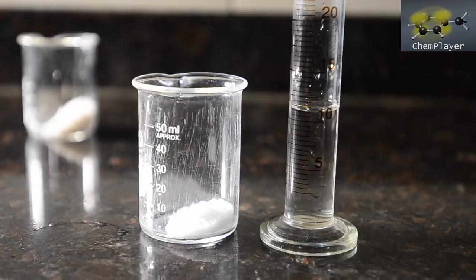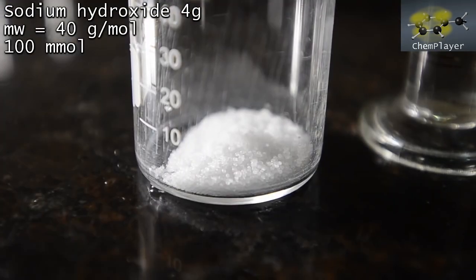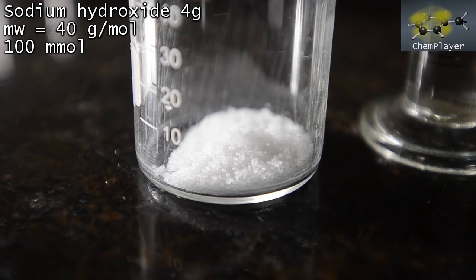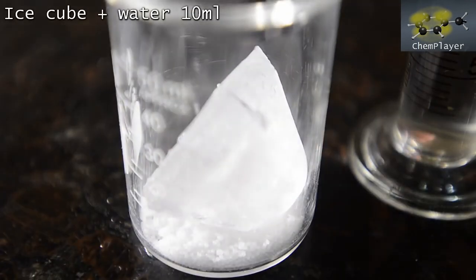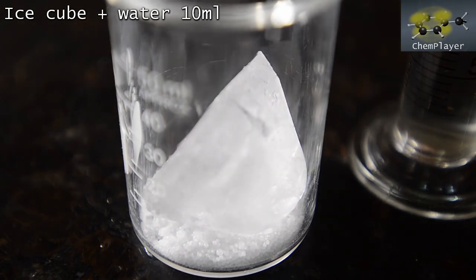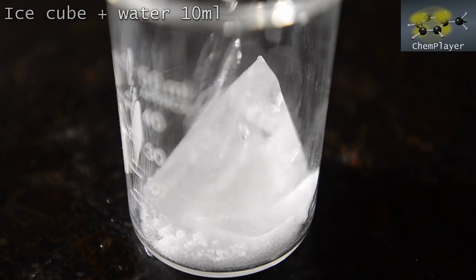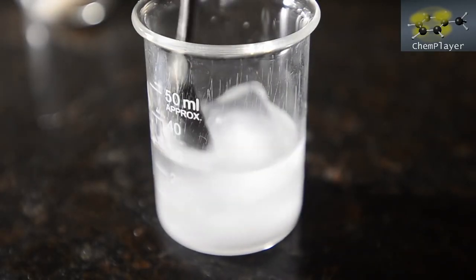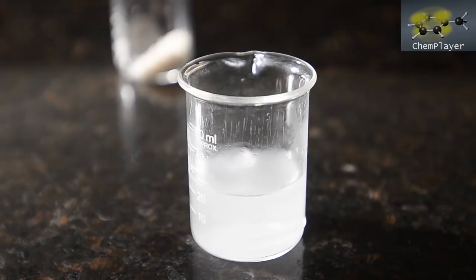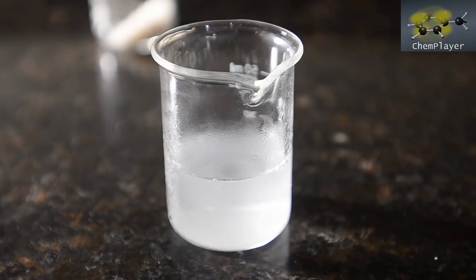Okay, to do the hydrolysis we're going to use sodium hydroxide. Here we've got 4 grams which is a 3 times molar ratio to the paracetamol we're using. Let's add an ice cube and 10 ml of water, and dissolve. Okay, this is looking good.